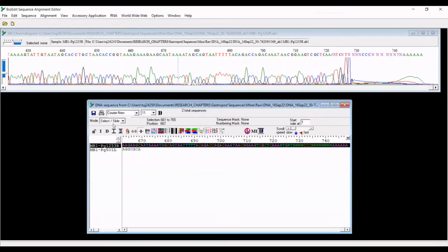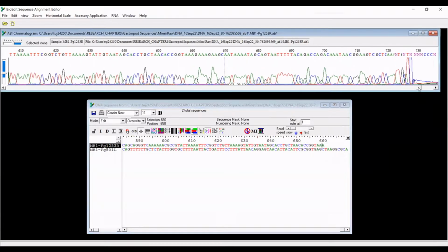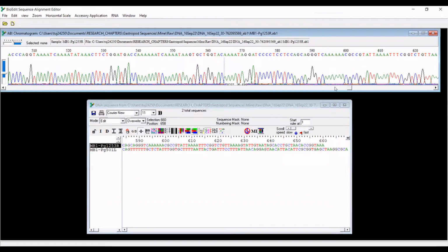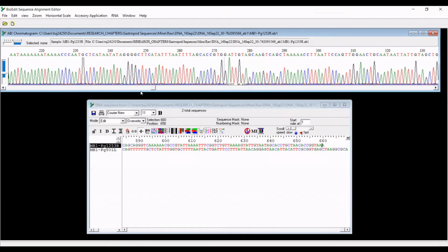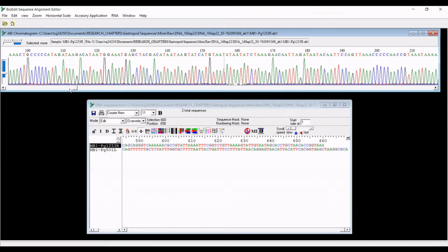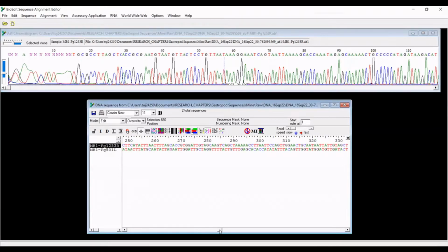So I'm just selecting this sequence here. And again, you need to change the mode, because otherwise, if you leave it at select/slide and you hit delete, nothing will happen. So you hit edit, and I'm going to delete that part of the sequence. Okay. And so I can already tell that this sequence is going to be shorter than the forward, and that is okay. And so I'm looking through, seeing if there's any ambiguity in these base calls, but I think this looks pretty good to me. Okay, so once again, we're going to go to the front of the sequence.